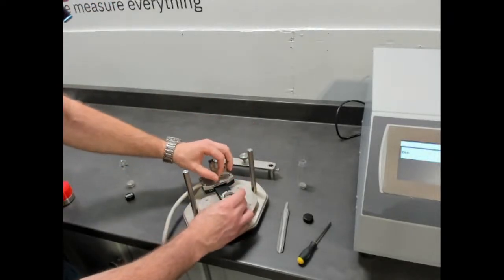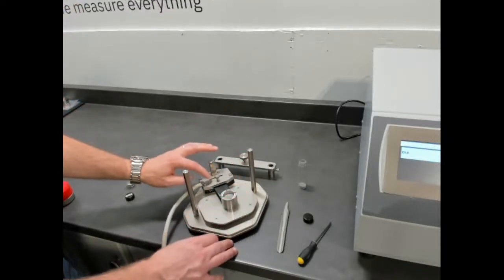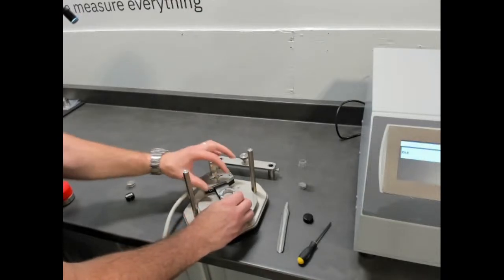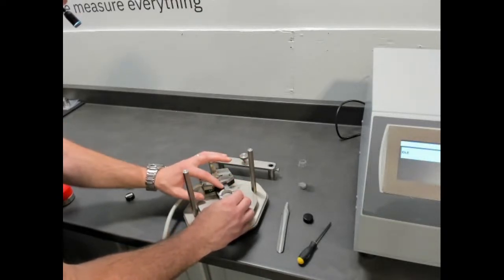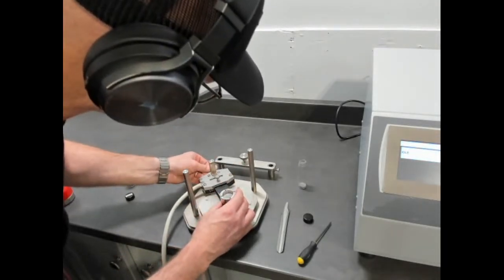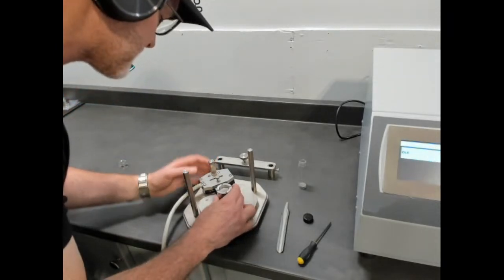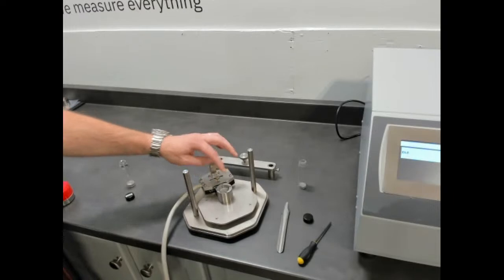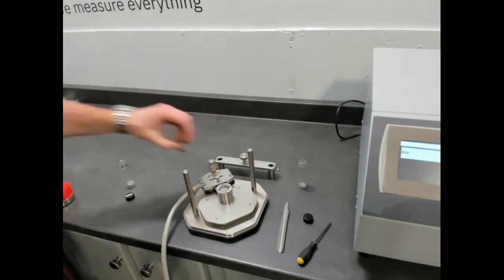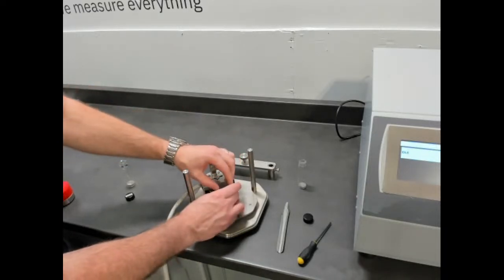Then, depending on your sample holder, this is the MP1 sensor adapter, there's an MP-V sensor adapter. We just slide that in until we see the contacts in the back. And then we have a sample setup with ambient density. Now normally we would take this weight and put it on. That would be the last step if you wanted to affix the weight, the density rather.